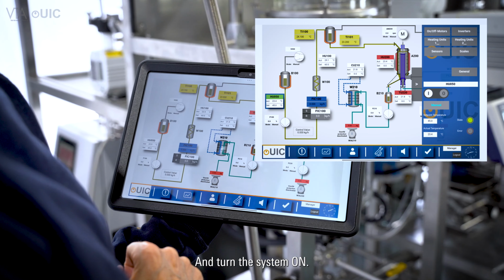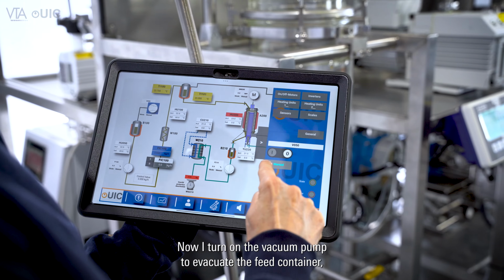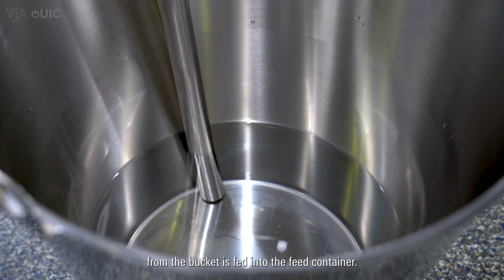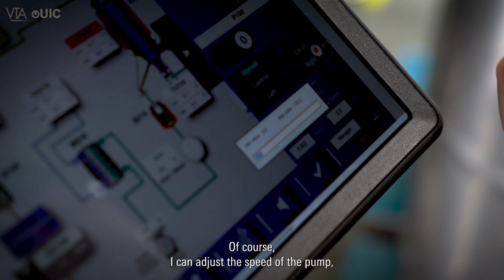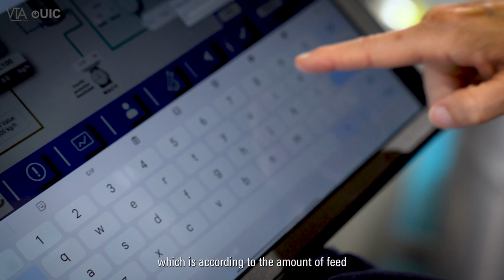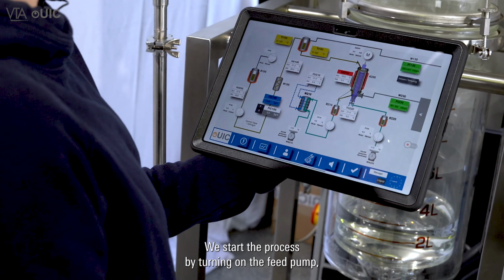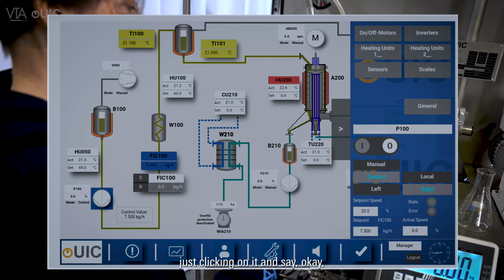Now I turn on the vacuum pump to evacuate the feed container, and in just a second you see how the feed material from the bucket is fed into the feed container. Of course, I can adjust the speed of the pump, which is according to the amount of feed which is fed into the system.